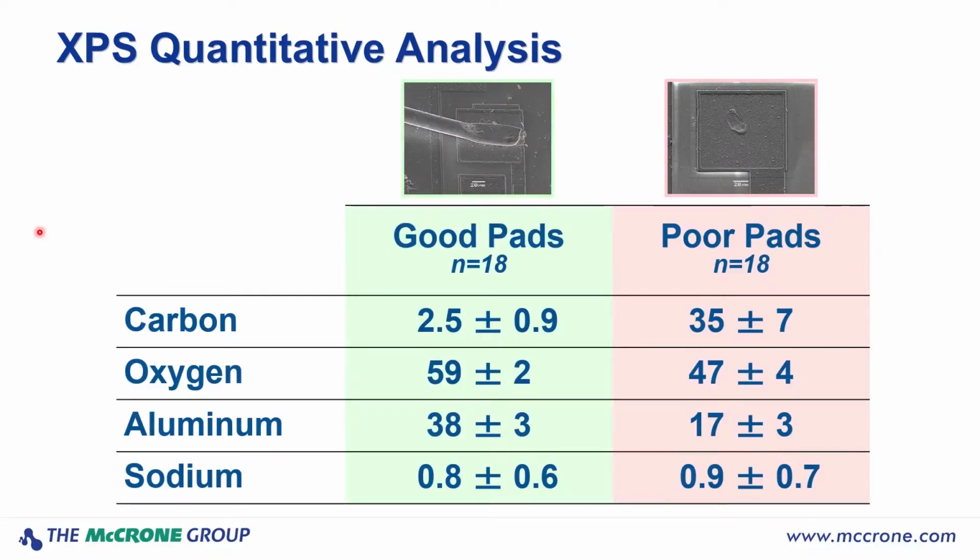In order to determine how much of the carbonaceous contaminant was present, a total of 18 good pads and 18 poor pads on a number of different dies were selected and analyzed, and then the spectra were quantified using standards. This table shows the results. One thing to remember is that the quantification of XPS data produces normalized results, so the results will add up to 100%. So in the case of the poor pads where you have a large amount of carbon, that actually attenuates the signal from the aluminum and oxygen underlying the carbonaceous layer. But you can see the dramatic difference between the good pads and the poor pads, and also that the results are fairly consistent. All the good pads have low carbon, all the poor pads have high carbon.